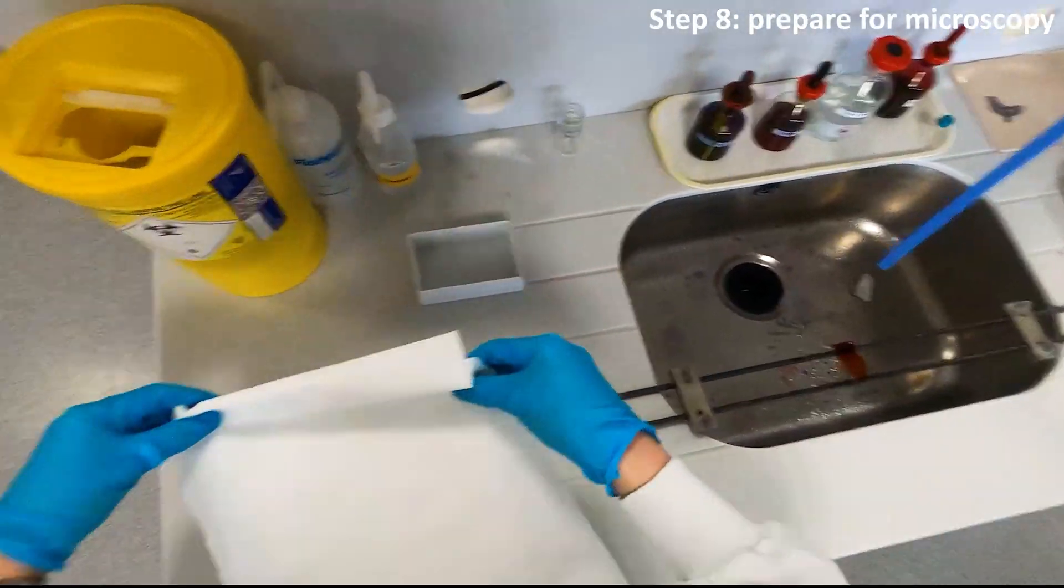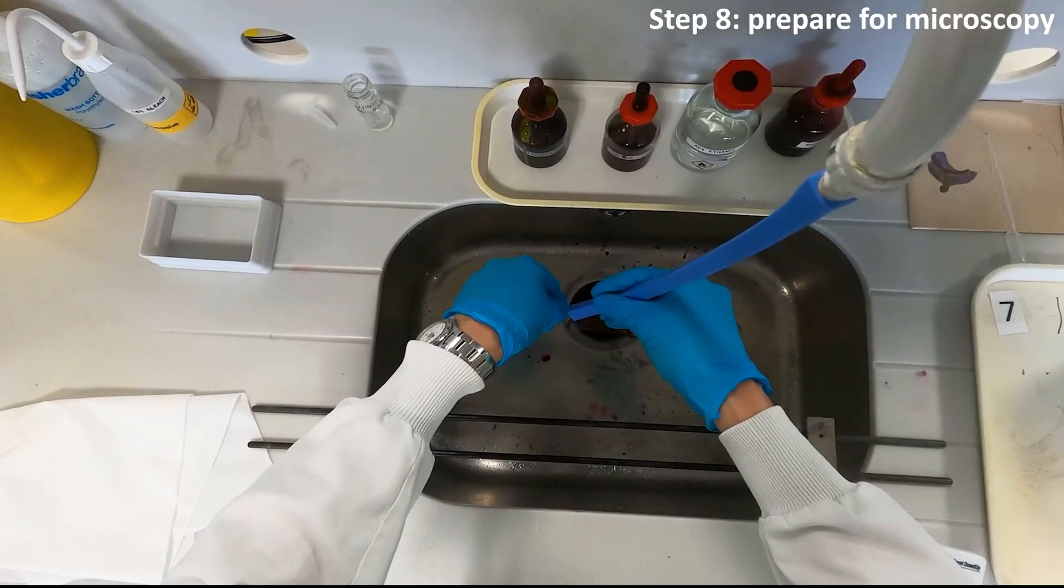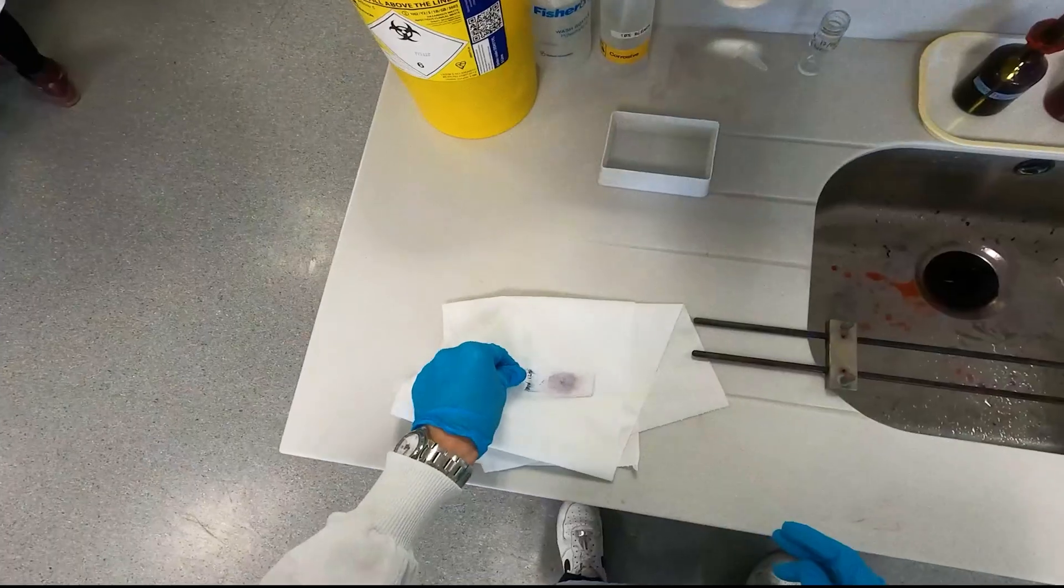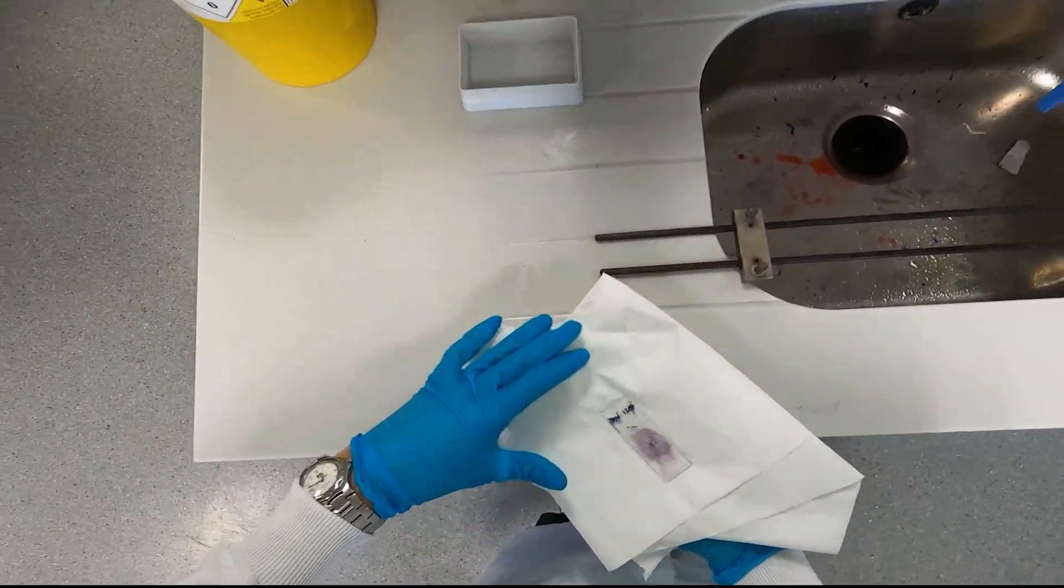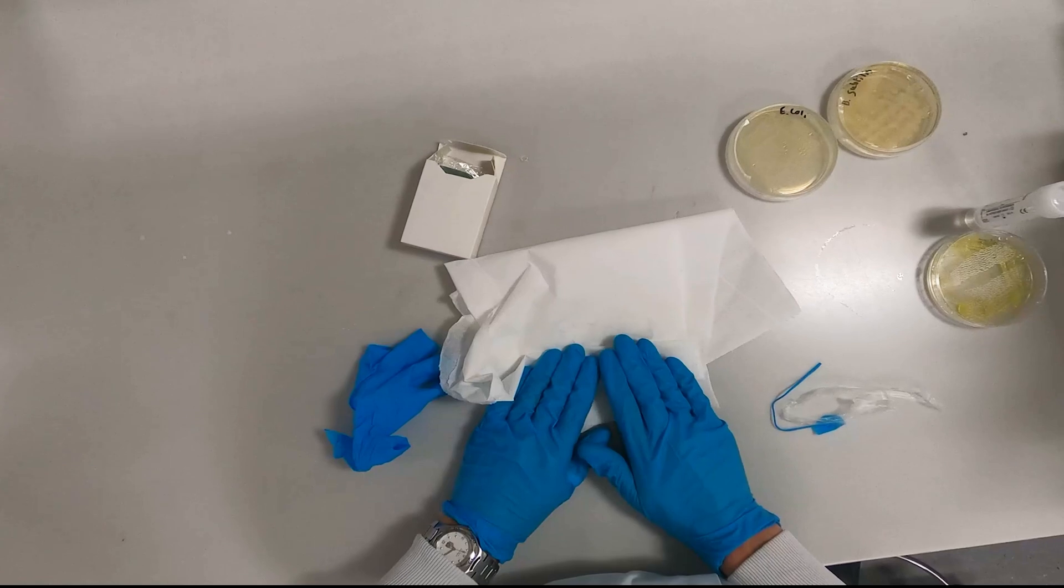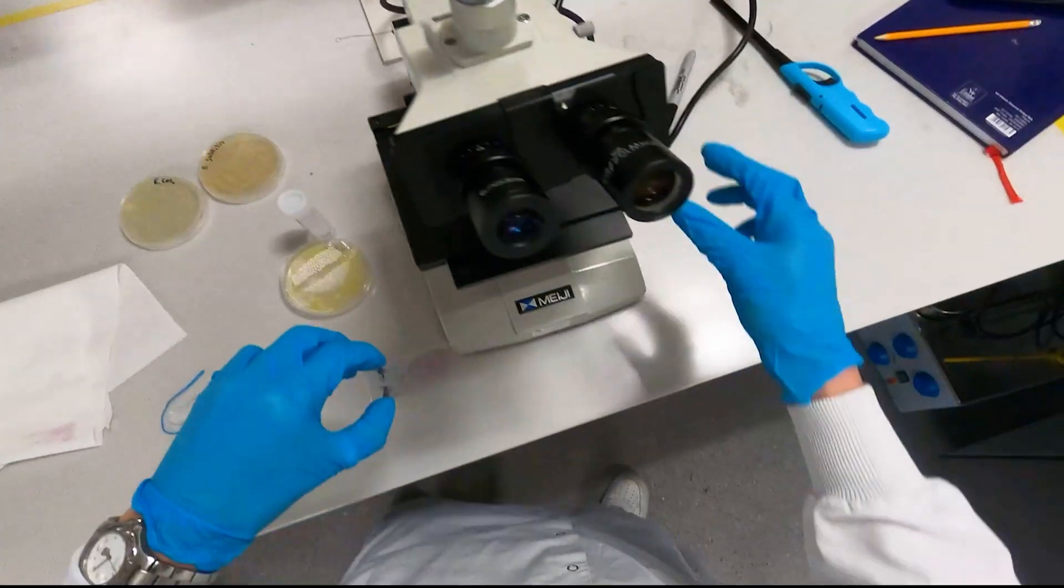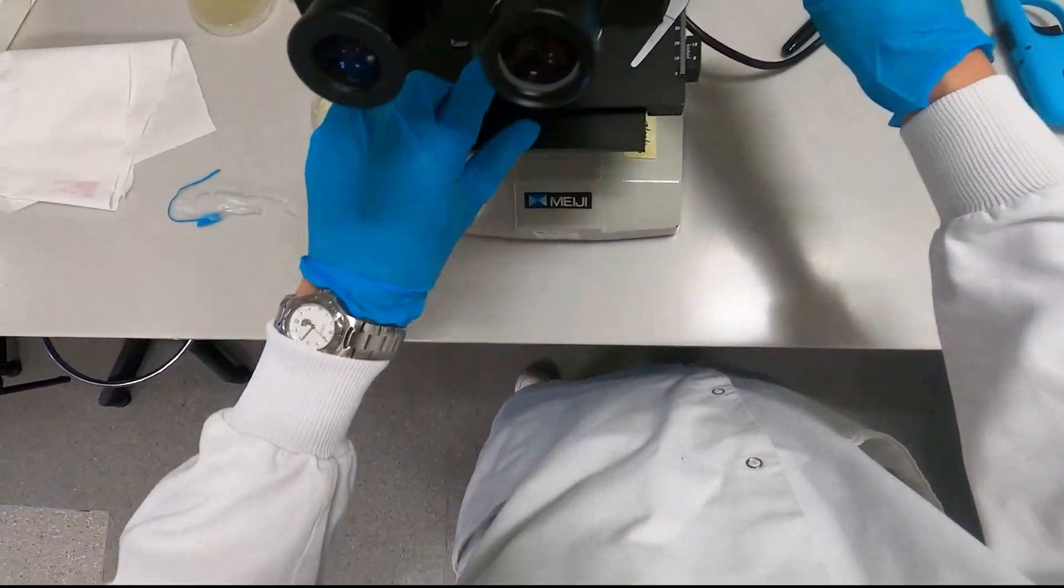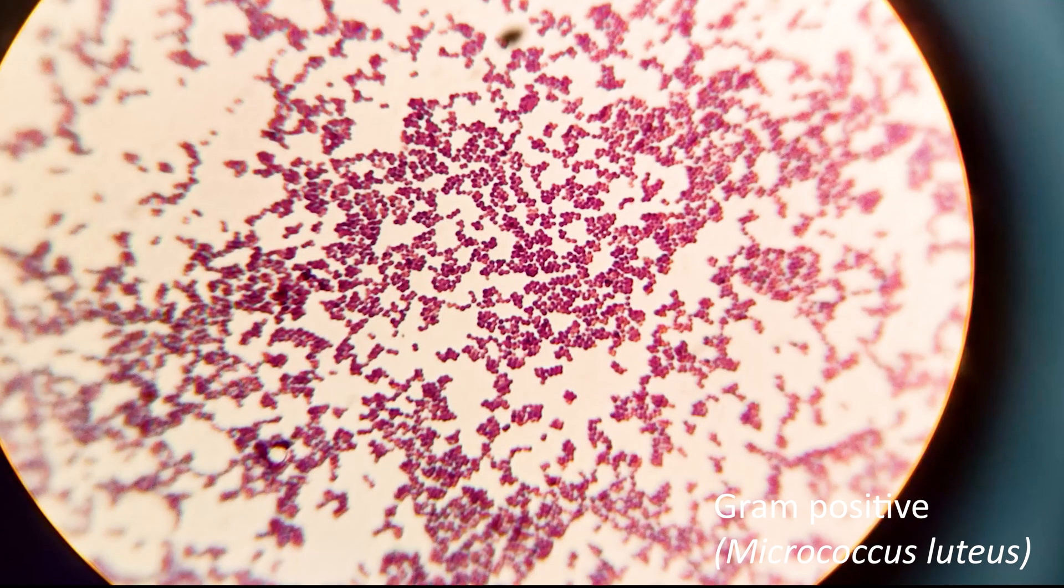All you need to do now is get some paper towels ready for your slide. Rinse the slide under running water for a final time until the safranin is gone and take it over to your lab bench. Gently pat your slide dry before observing under the microscope. And what you should see is something very cool.